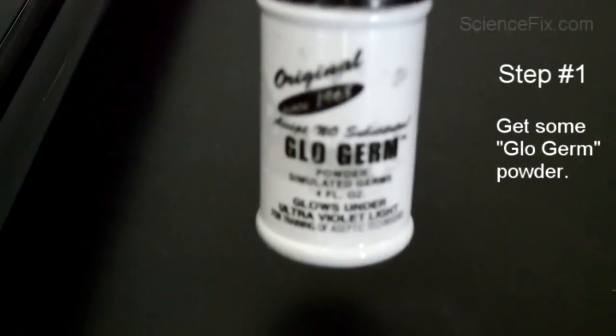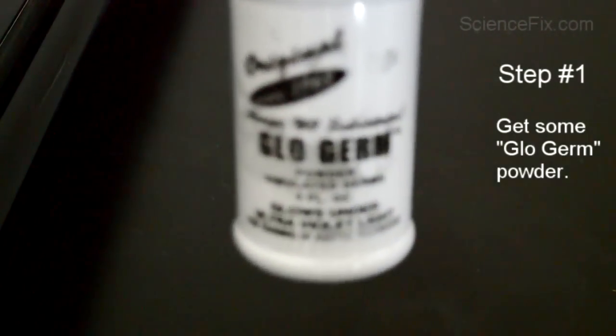How can you get across to your students the importance of hand-washing? Step one, get yourself some glow germ powder. This is pretty readily available online.